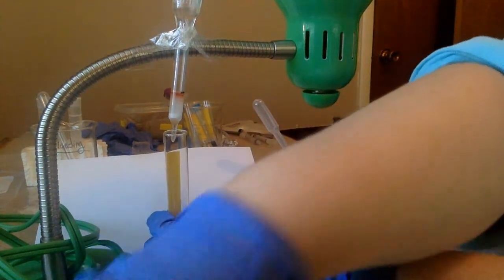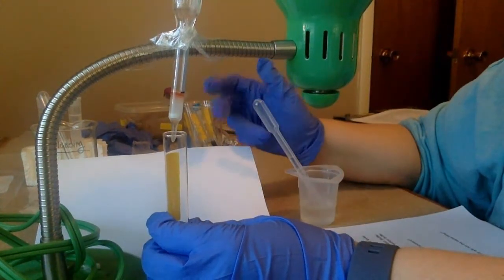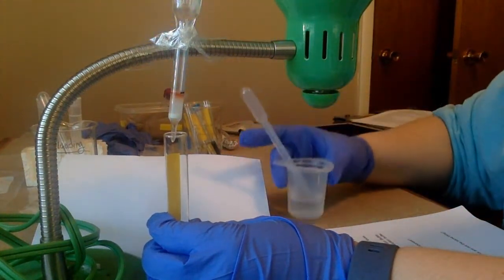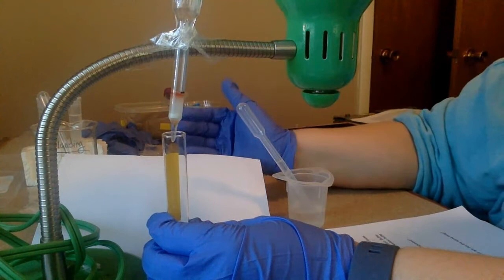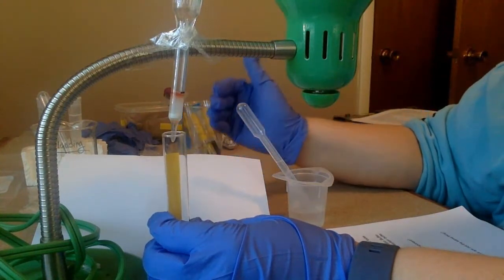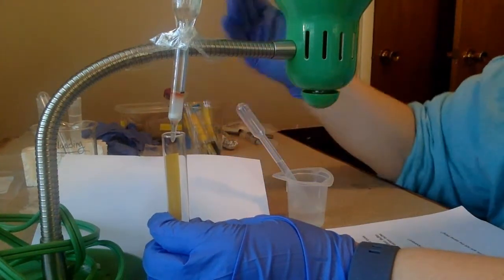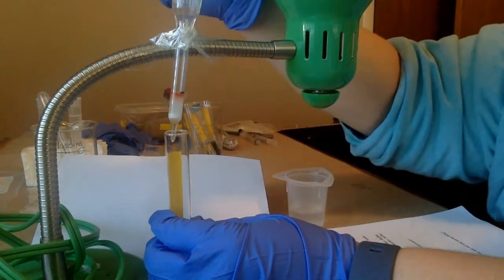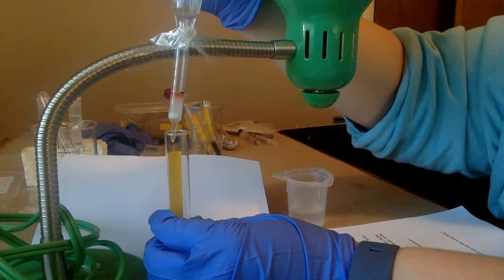sorry, my thing died here. So when it's in a basic environment or when I push through a basic solution, the toxin will change charge to negative. And if the beads inside are negative and the toxin is negative, it's going to wash through. It's no longer going to stick. So this should happen fairly quickly as I put these in.